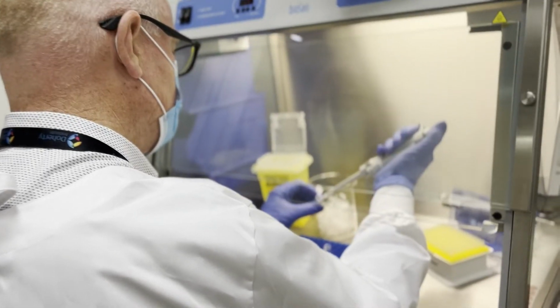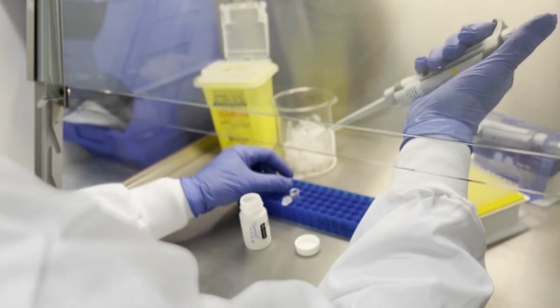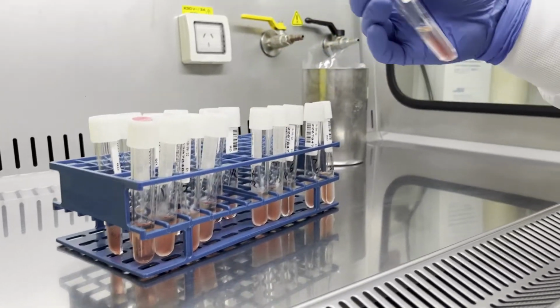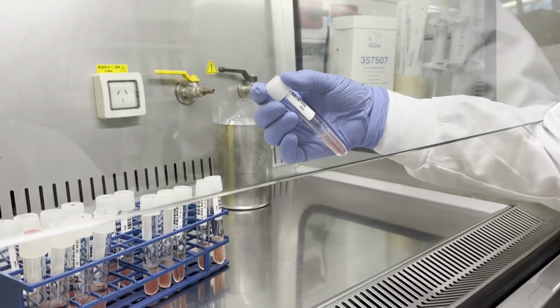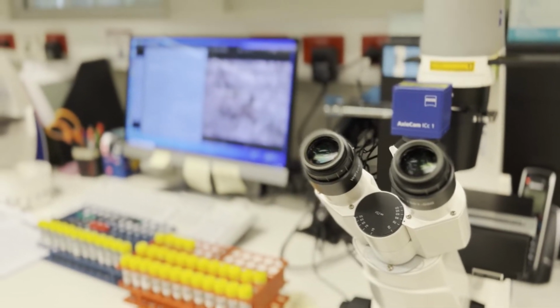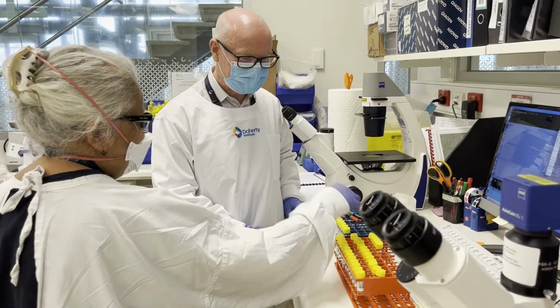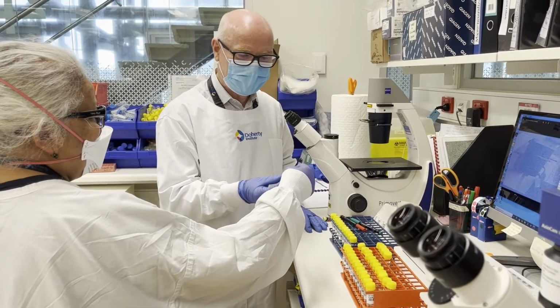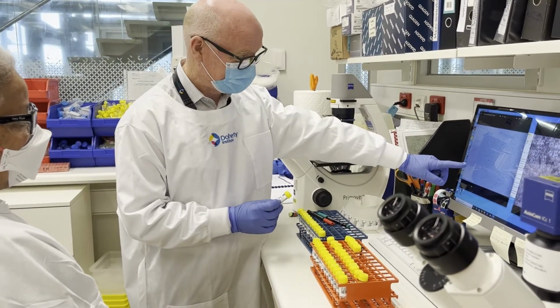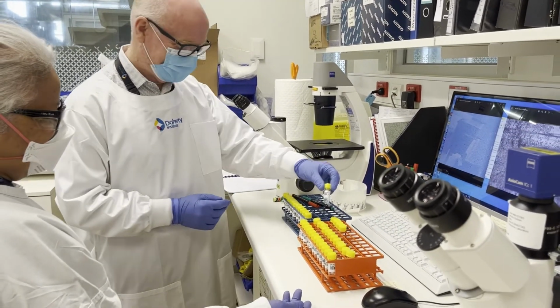We can grow enteroviruses in culture. We use small tubes and we can look at them by making an aliquot from a stool suspension and inoculating onto the cells and then looking under a microscope each day. And if there is an enterovirus, it can appear to kill the cells, which we call cytopathic effect. And that's where actually the cells are destroyed and that's visible under a microscope.